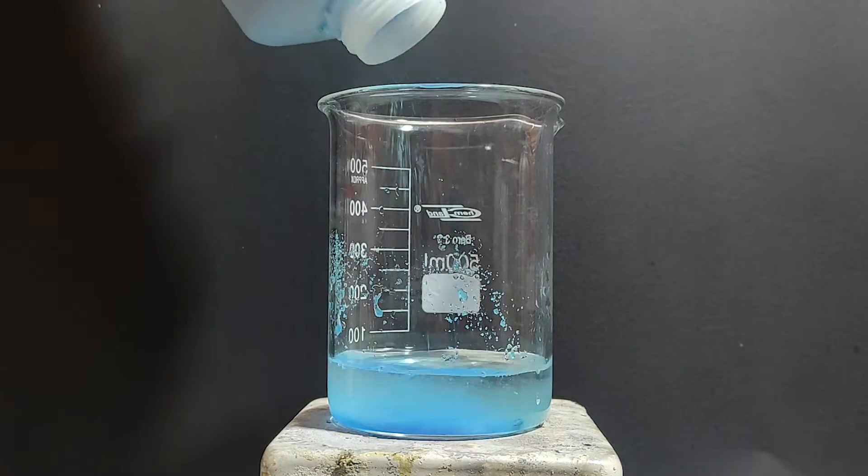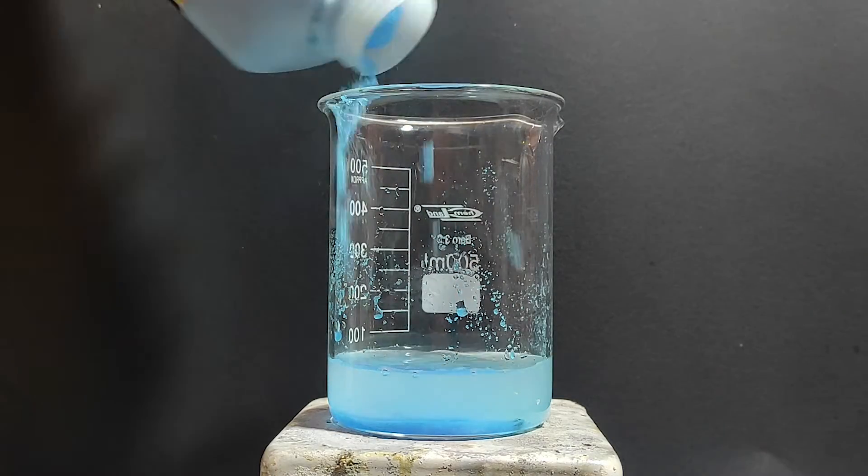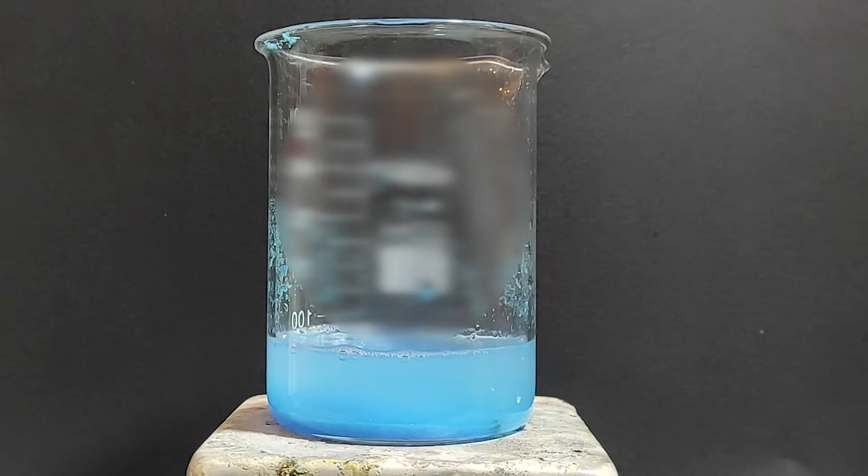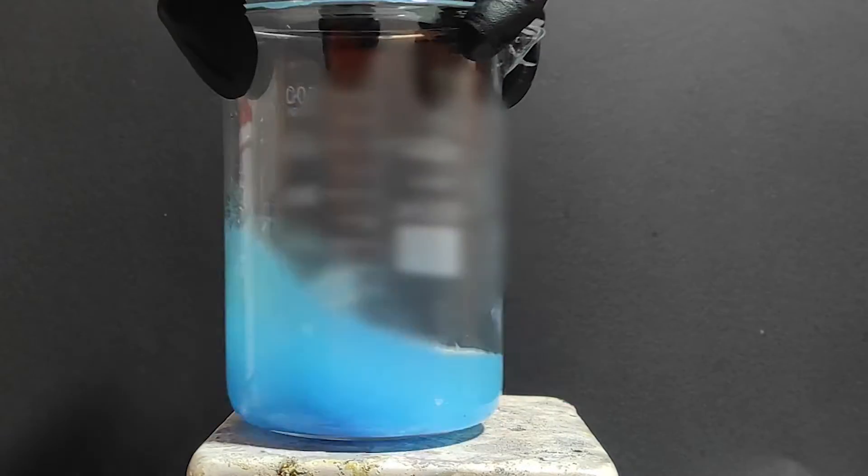To the beaker I've added some water and then added a bunch of copper sulfate. What we're doing here is preparing a concentrated copper sulfate solution. The copper sulfate is stirred until nothing else will dissolve.